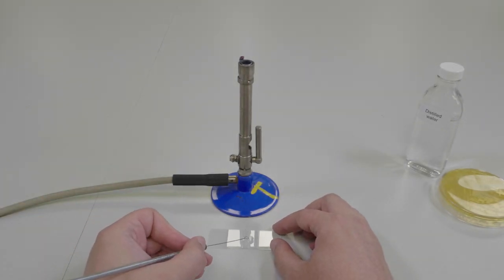Mix your sample of bacteria into the water on your microscope slide and mix in concentric circles out to about the size of two postage stamps.